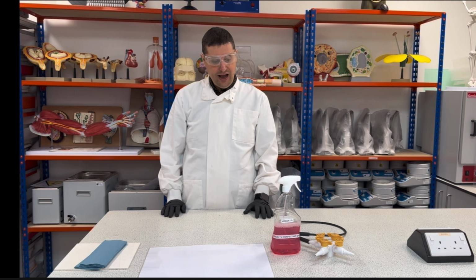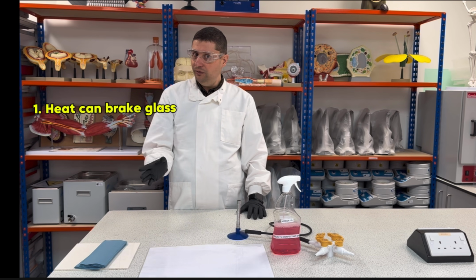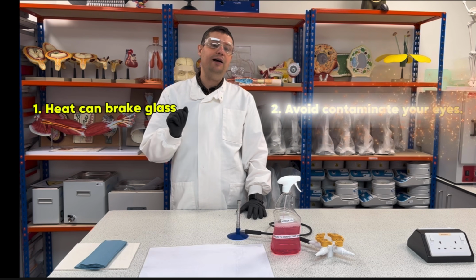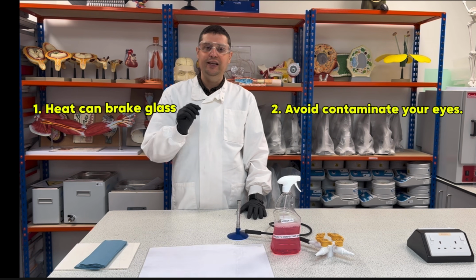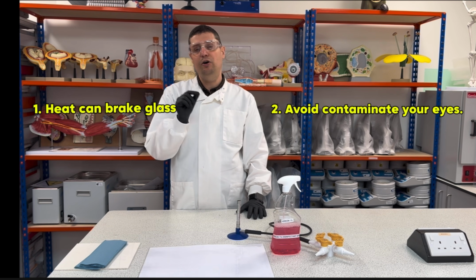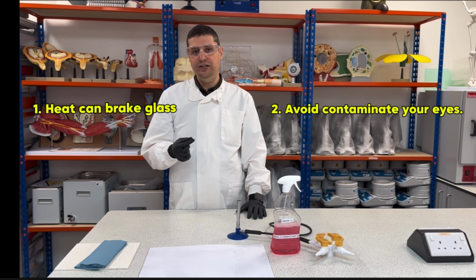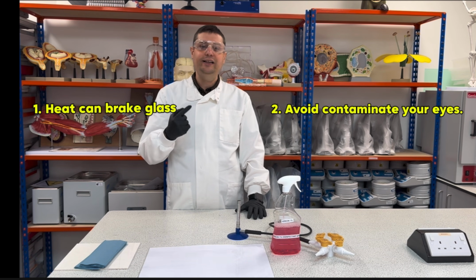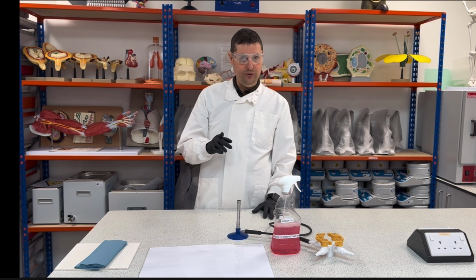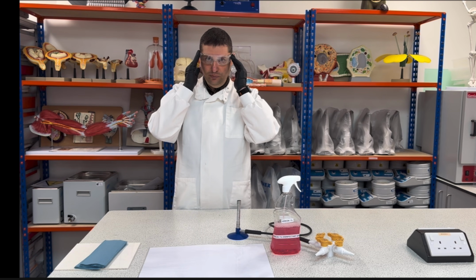Two things. I will be dealing with a flame, so something can go wrong every time I'm dealing with a flame. And second, because I'm using bacteria, even if the bacteria I'm using, in small amounts and small population, do not cause any harm to me, if it's in a big concentration and goes in my eyes, it can cause an eye infection. So you need to be very careful, okay? This is for your own protection, okay?